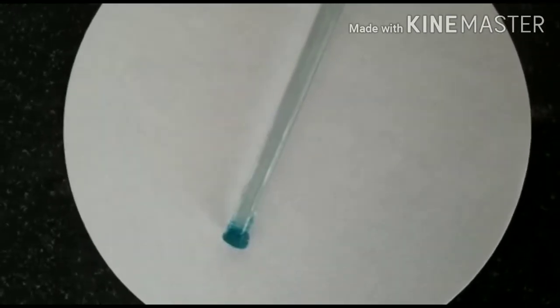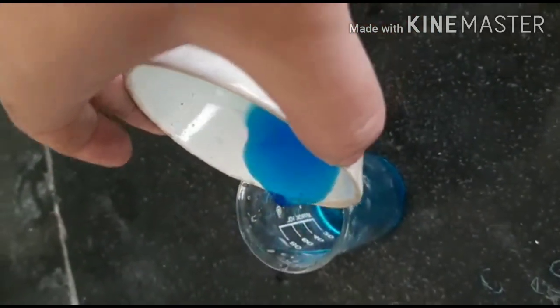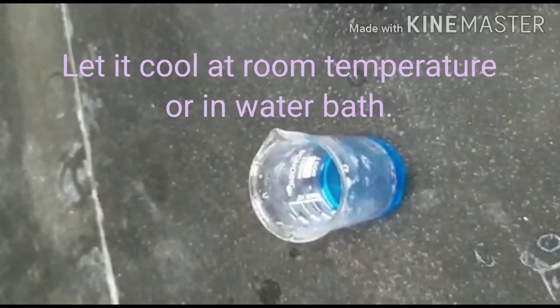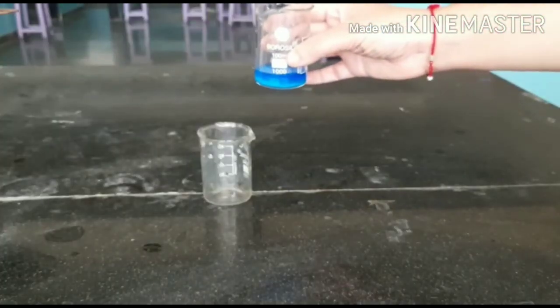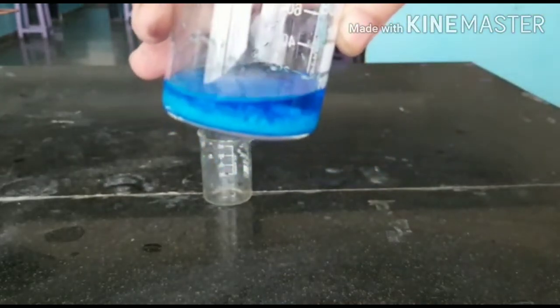That means crystallization has started. We will transfer this liquid into another container for the crystallization process and let it cool at room temperature. After complete crystallization has occurred, as you can see, it has been crystallized.